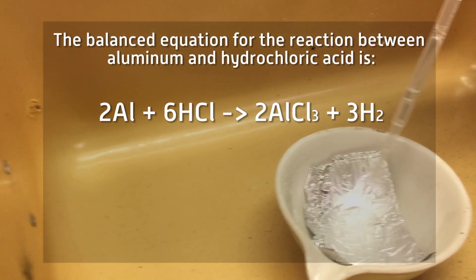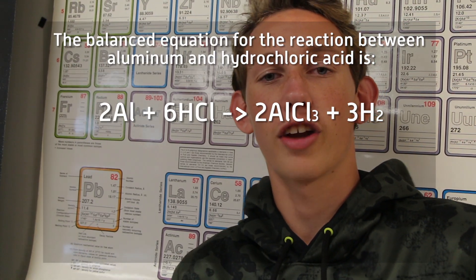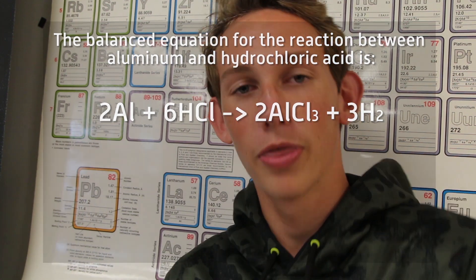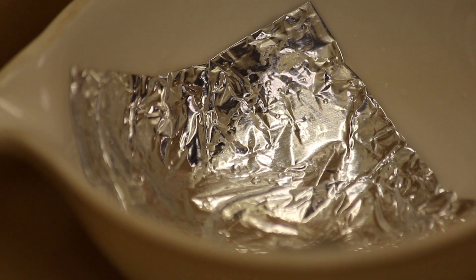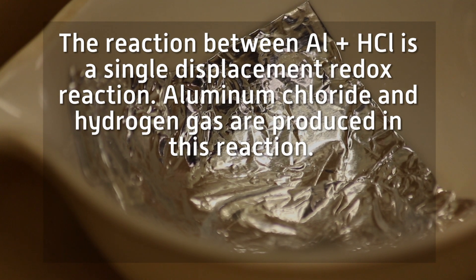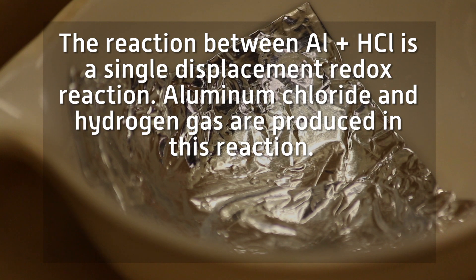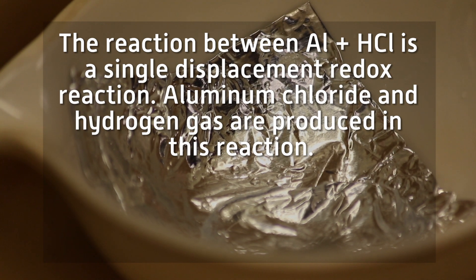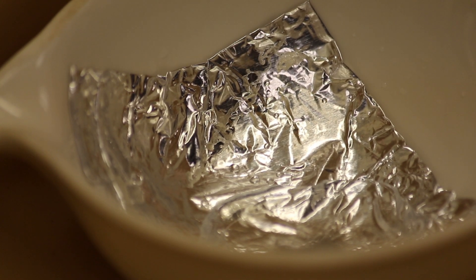We started by reacting aluminum with hydrochloric acid. Once we put the aluminum in, the reaction started to bubble. The aluminum began to react with the hydrochloric acid — it's going to knock the hydrogens off. Each aluminum is going to grab three of the chlorine atoms, and it's going to give off heat.